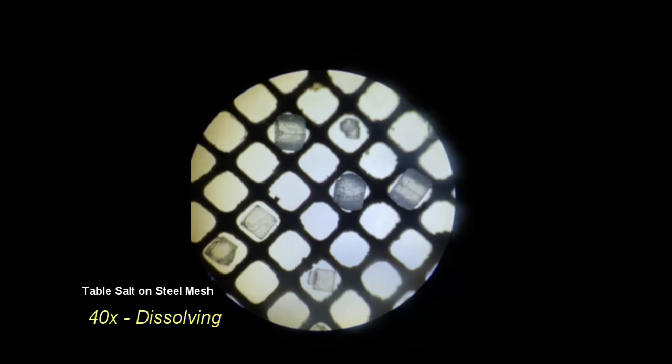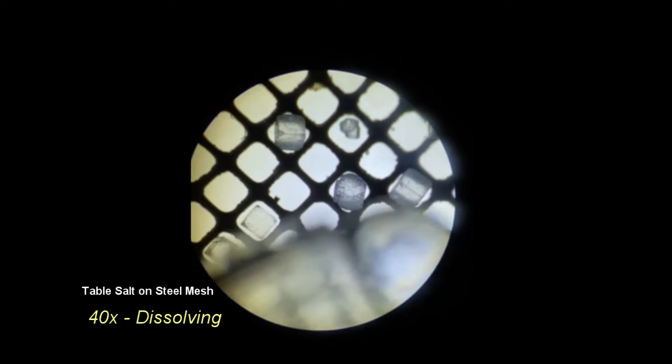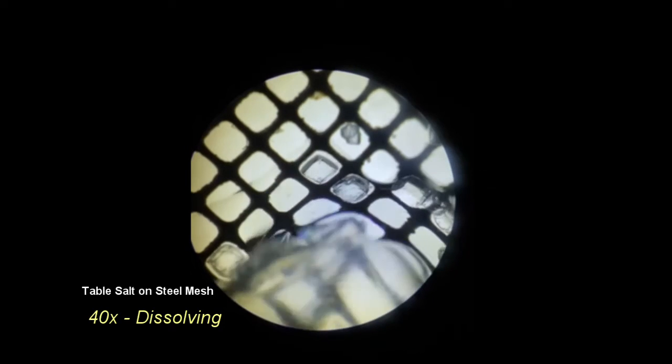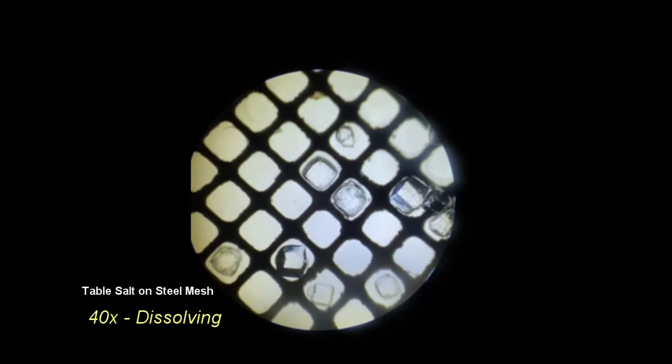In this clip, one of the methods of filtration that was used during the separating mixtures lab is visualized under the microscope. There have been some crystals of table salt added to the mesh, some of which fit through the holes naturally, others were too large.